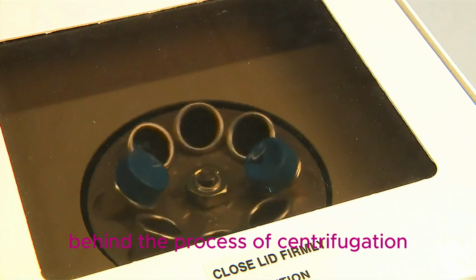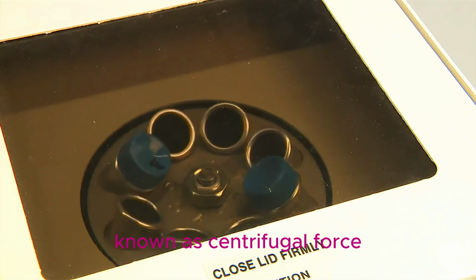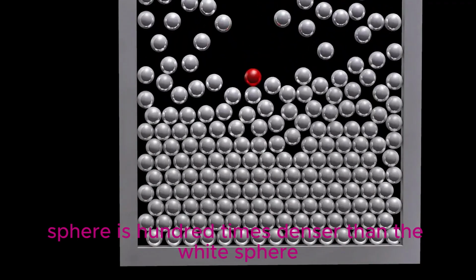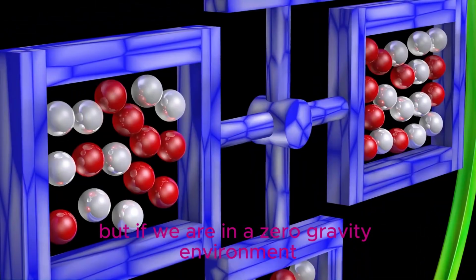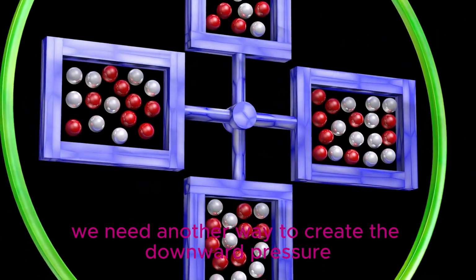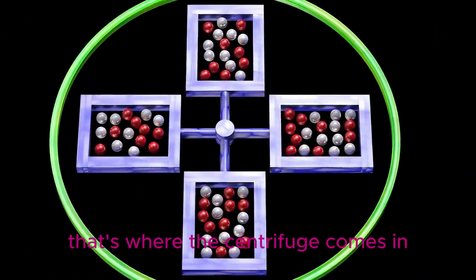Behind the process of centrifugation, there is a physics concept used known as centrifugal force. In this environment, the red sphere is 100 times denser than the white sphere. Under normal pull of gravity, it quickly sinks to the bottom. But if we are in a zero gravity environment and still need to separate these particles, we need another way to create the downward pressure. That's where the centrifuge comes in.